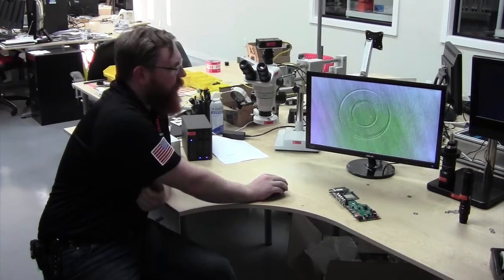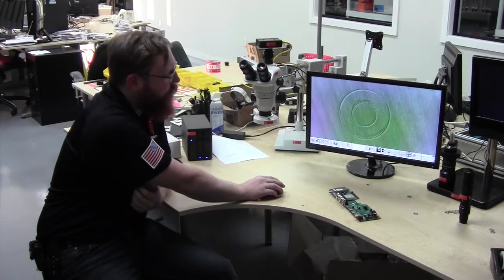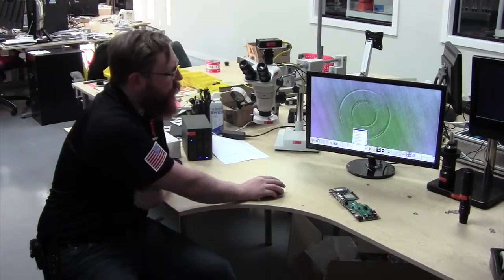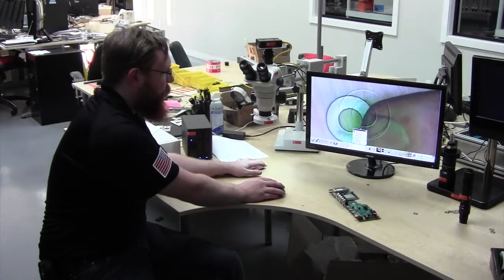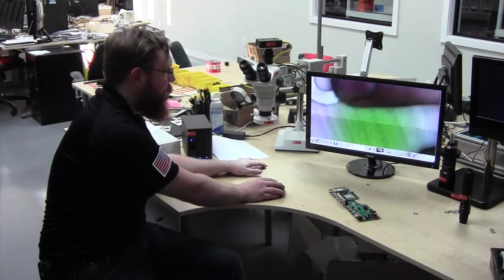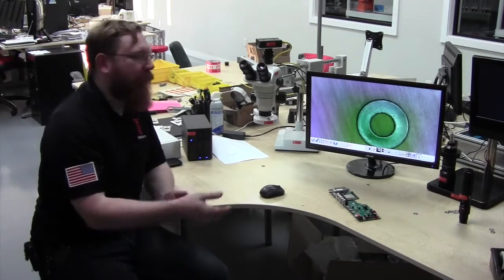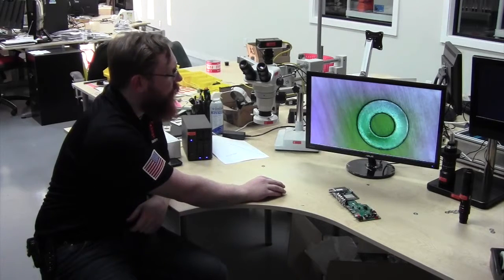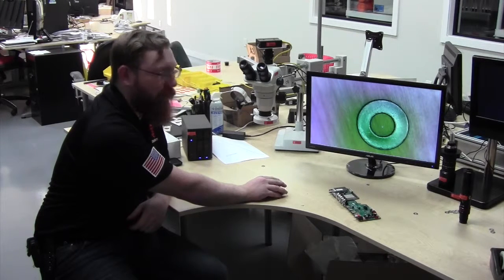One other thing you can do with this, and this is useful for parts of any size, anything that you need dimensionality with, is this button right here controls your crosshairs. Now what you can do with this is have your image, or your live image. And again, these are all techniques for getting a base image to make further inspection of product easier and more reliable throughout the process. With these controls, you can set several different crosshairs if you want.